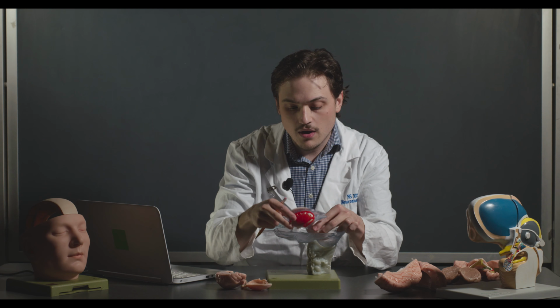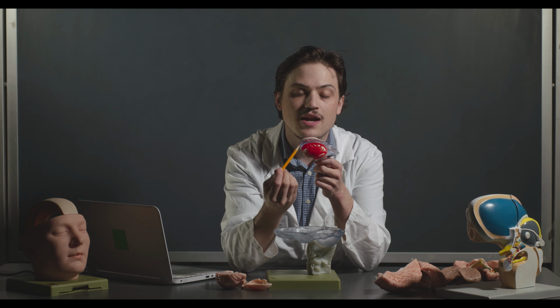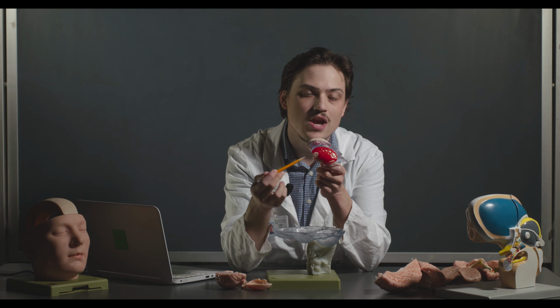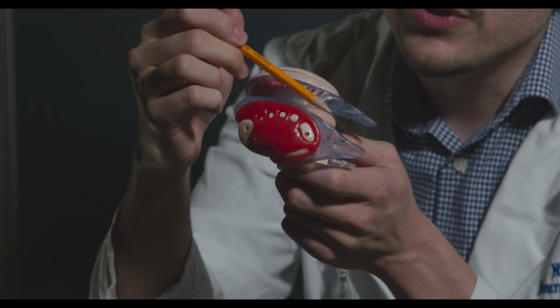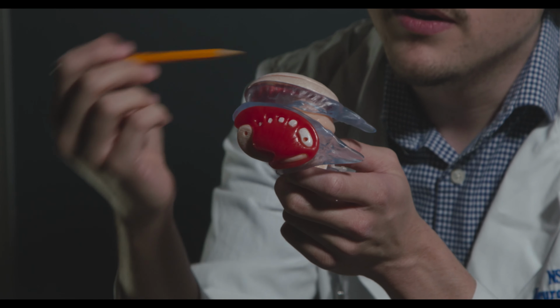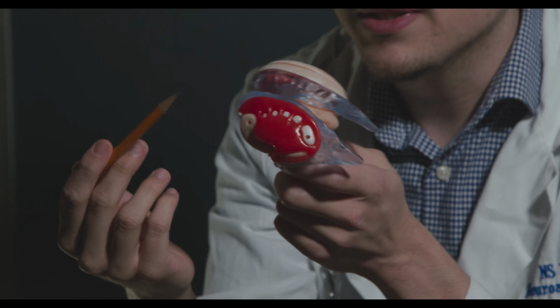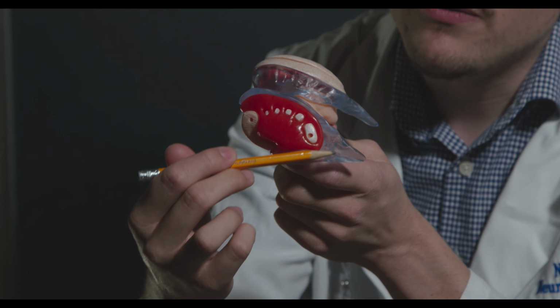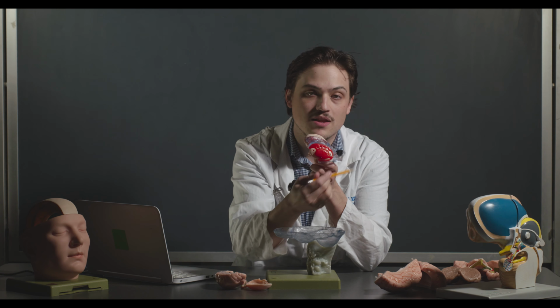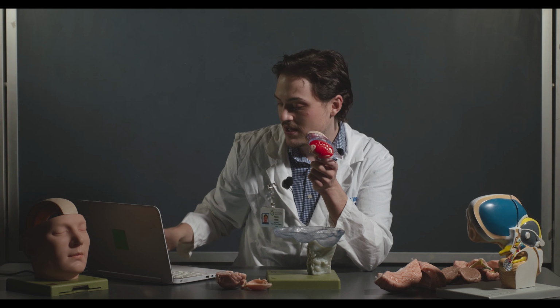So a lot of these basal ganglia structures actually have this characteristic C shape. That's due to the telencephalon folding over the diencephalon, which is essentially the top of the brainstem here, including things like the thalamus and the hypothalamus. And so a lot of the basal ganglia structures, as well as the ventricles and the hippocampus, have that kind of C shape. So just keep in mind that the reason it's like that is because of the telencephalon folding over.